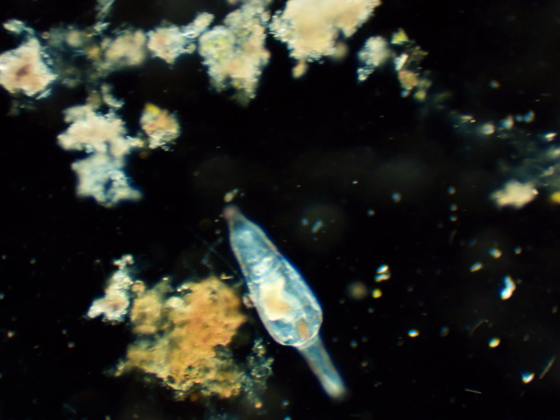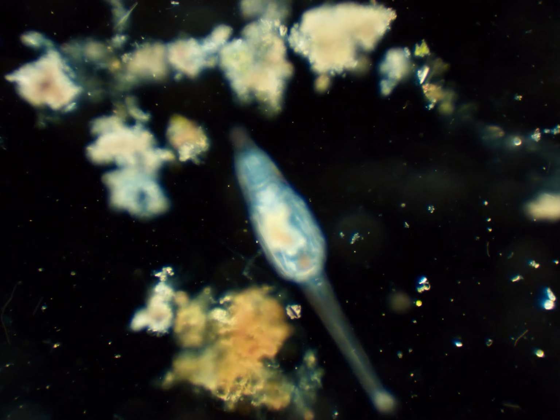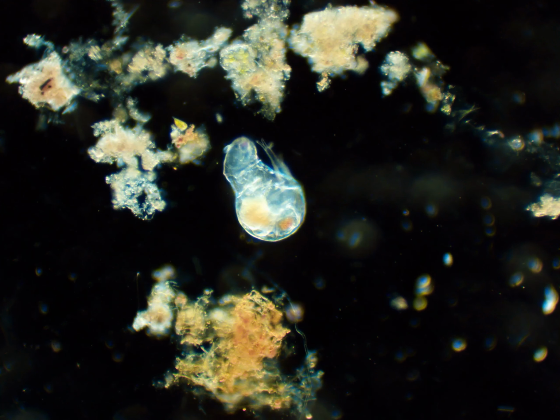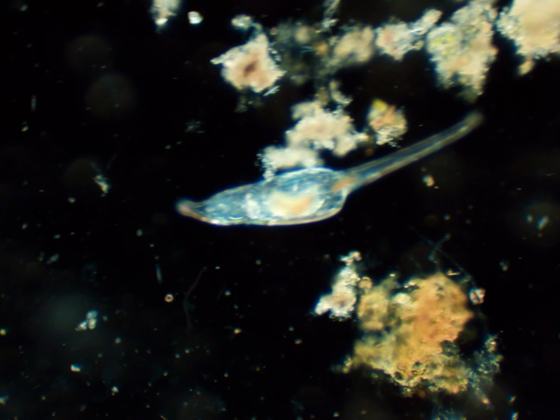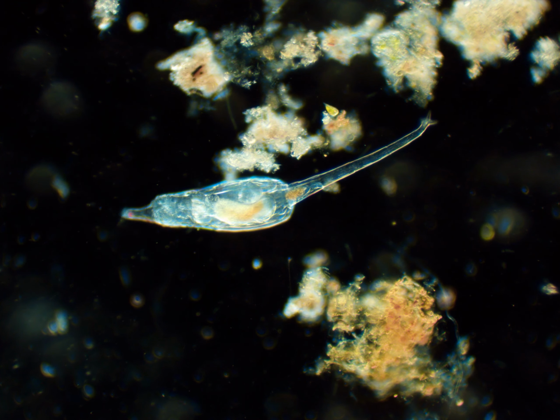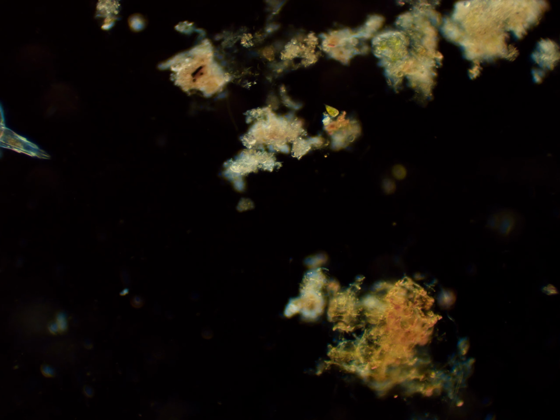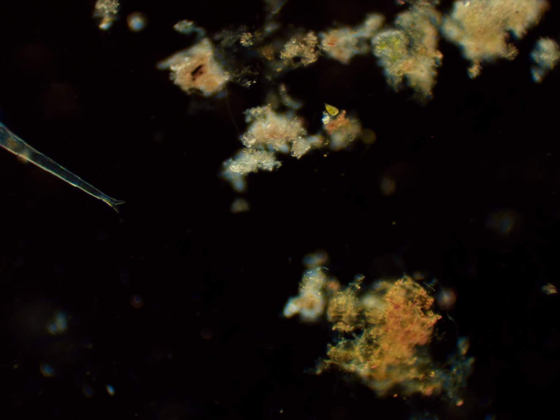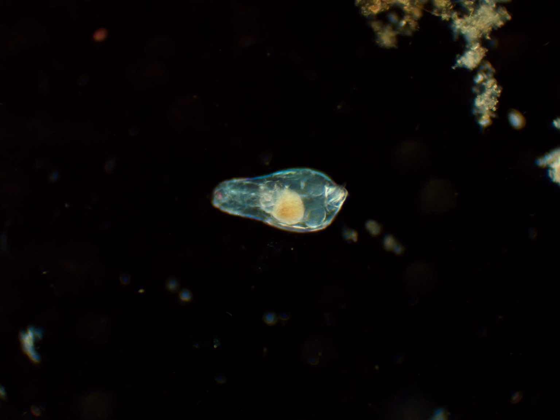So here are a bunch of organisms from the phylum Rotifera. On this slide I found several of these rotifers. I believe they are from the genus Bdelloidea. I've seen several bdelloids before. They were in some of my first freshwater living samples. I used to get them from my fish tank filters.